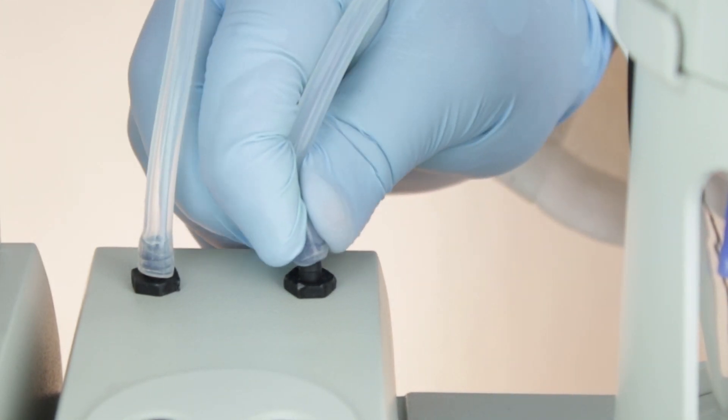To complete assembly, plug the titrator in and flip the power switch. Once the titrator is finished booting, it will take you to the main titration screen.